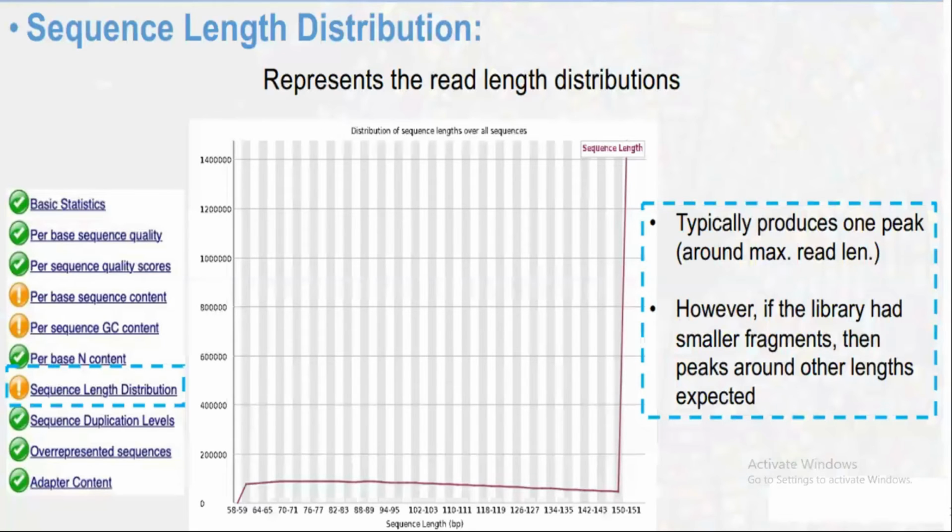Now, the sequence length distribution. Sequence length distribution is also very important. At the start of this video, I showed you that my sequences were between 60 and 150. So the length of the sequencing reads also matters. The longer the better; it is better that it should be near 150 or so. Most of the sequencing reads have a length between 150 and 151. Although there are reads with lengths of 58, 59, 64, 65, they are fewer in number. So it is not perfect, it is a warning, but it is acceptable.